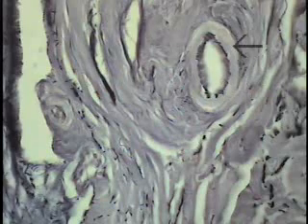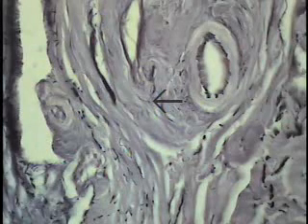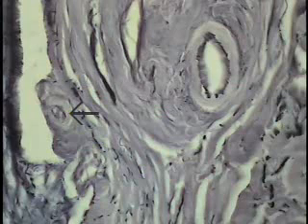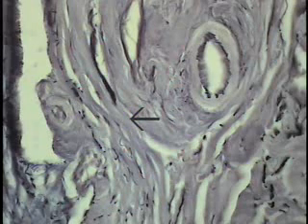So this is probably one of the smallest tributaries of a small artery, so it would be the smallest caliber of the small arteries, and this is an arteriole showing you the persistence of that very prominent smooth muscle wall within the media, as well as the persistence of the internal elastic membrane, as indicated by the pointer. So this is the arterial side of the vascular tree.